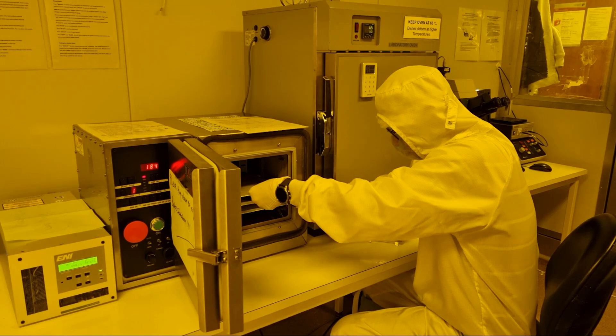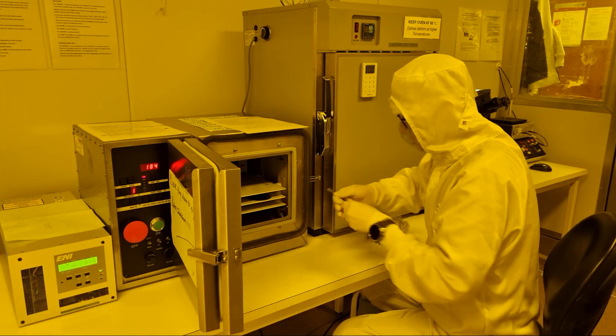Start with a strong plasma treatment. If the wafer is new, there is no need for other cleaning steps.